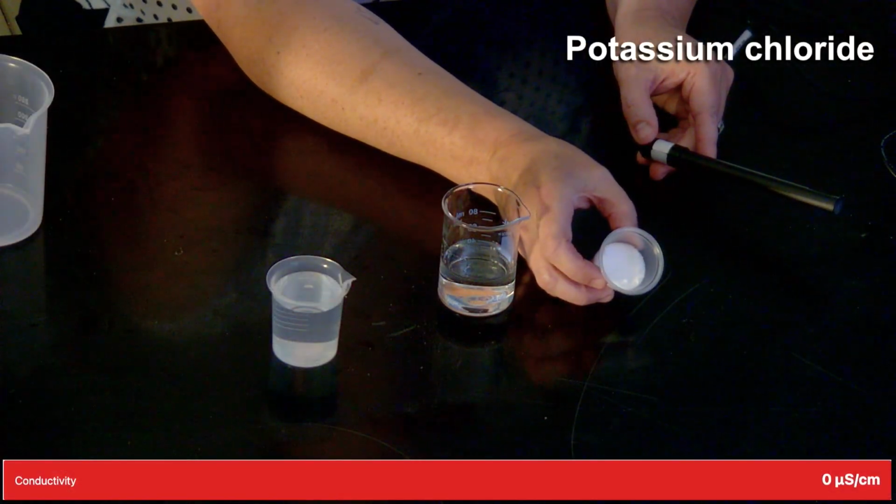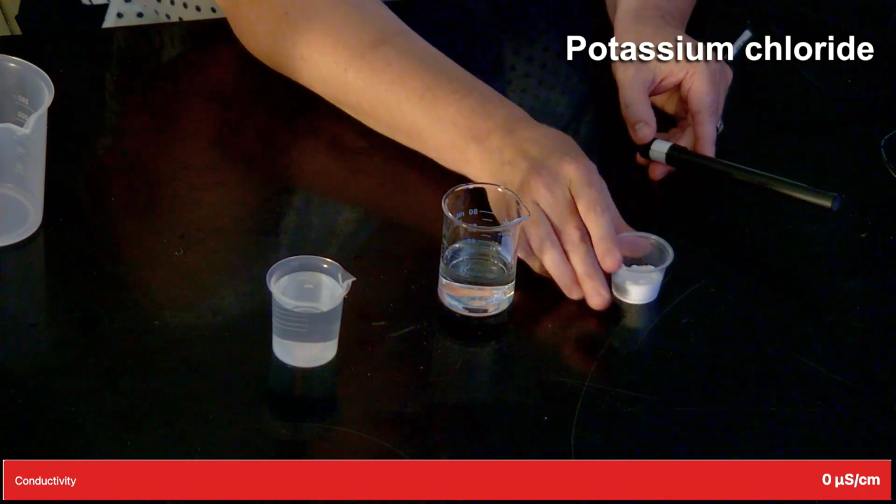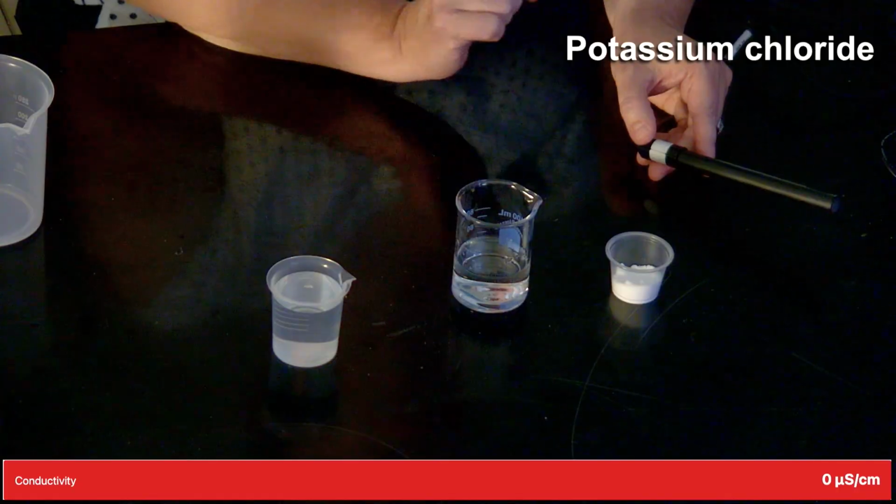So you would indicate yes on your data table. If it's below 200, we consider it not conductive. And so you would indicate no. All right, we'll begin with potassium chloride, which again is a white granular substance. And I have some already added here to my container of water.